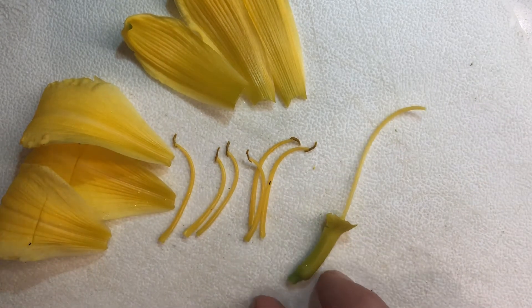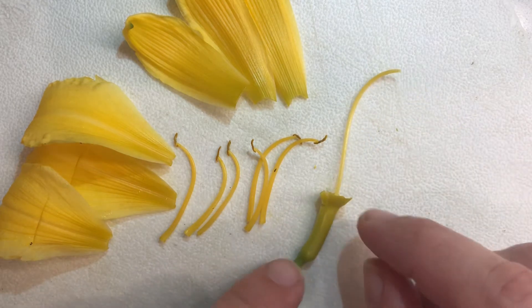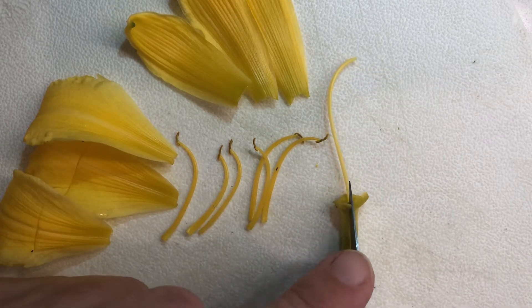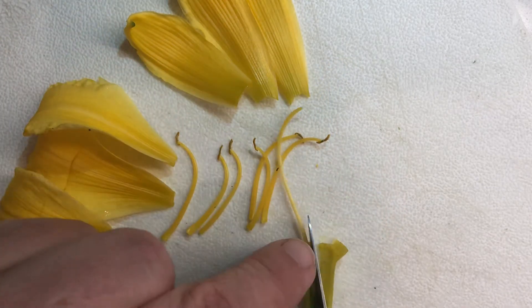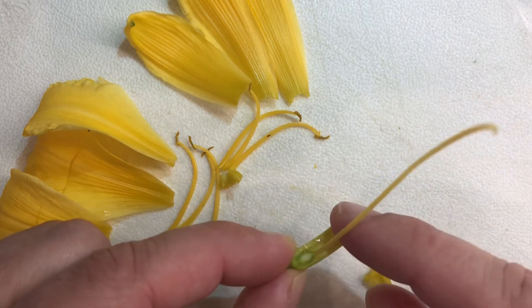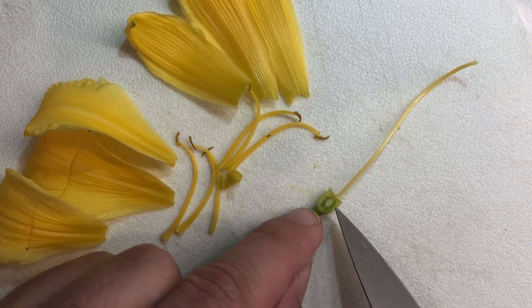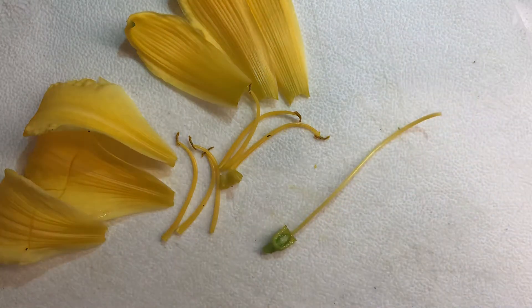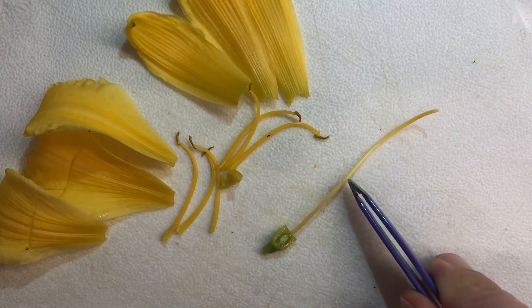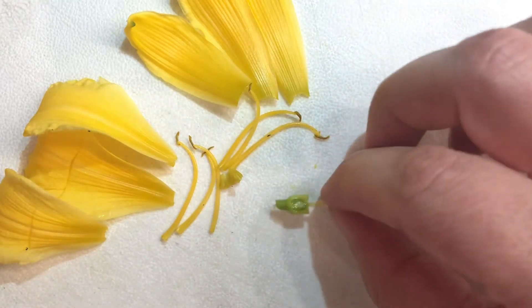Now we're left with the carpel, which is the female reproductive part of the plant. The base of the carpel is the receptacle — that's where everything was attached to. And if I cut open this ovary — this worked perfectly. This part is all receptacle, and the ovary is the green part at the base. The carpel together consists of the tip here which is called the stigma — that's where the pollen is going to land — and this long tube called the style, which goes all the way down into the ovary.